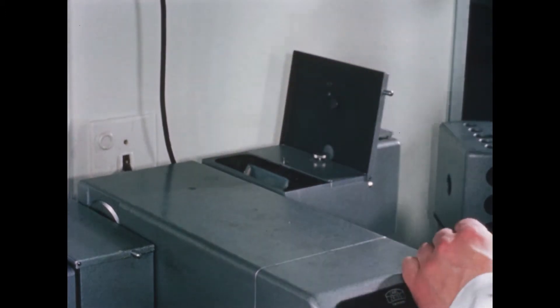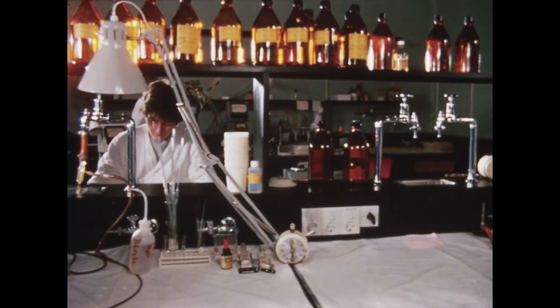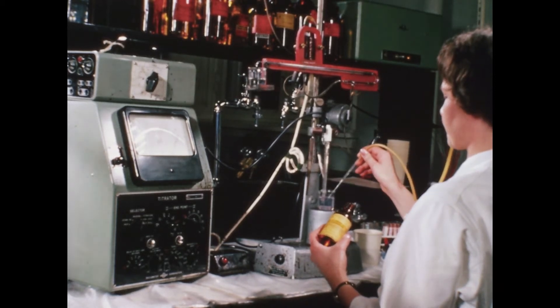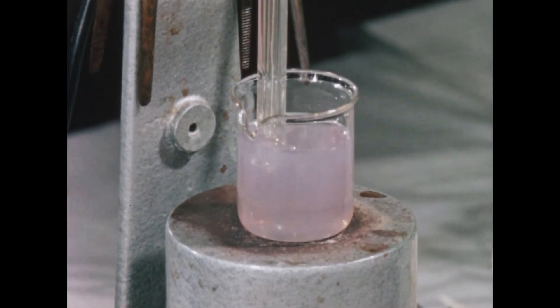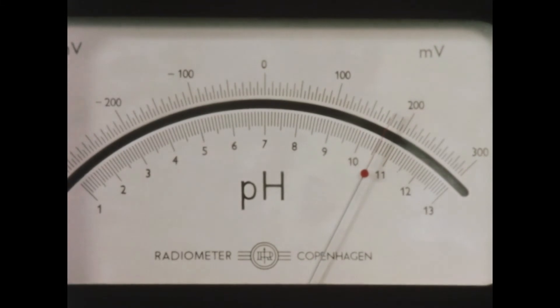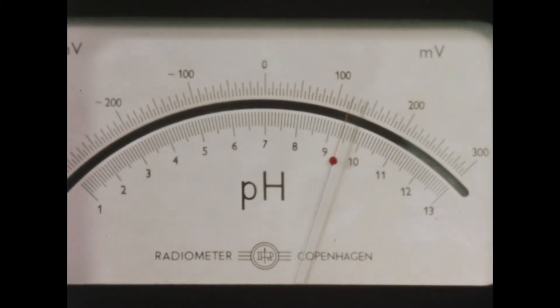Often it is advantageous to apply extensive automation of the analysis. This reduces the risk of error and eliminates subjective estimation. Determination of chloride in serum is done by titration of the serum specimen with silver nitrate during magnetic stirring. By means of a silver electrode and a reference electrode, the potential of the fluid may be measured continuously and changes during the titration may be observed. After determination of the potential corresponding to the endpoint of the titration, meaning that free silver ions appear in the fluid, the apparatus may be adjusted so that the supply of silver nitrate stops automatically when the titration has run its course.